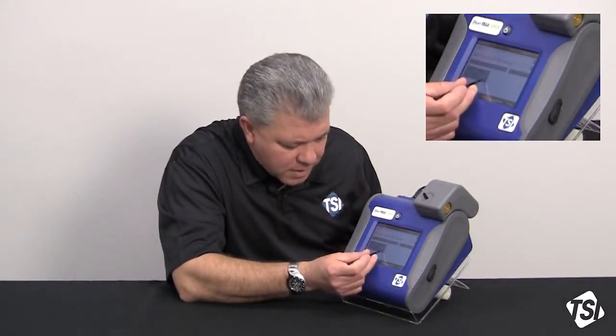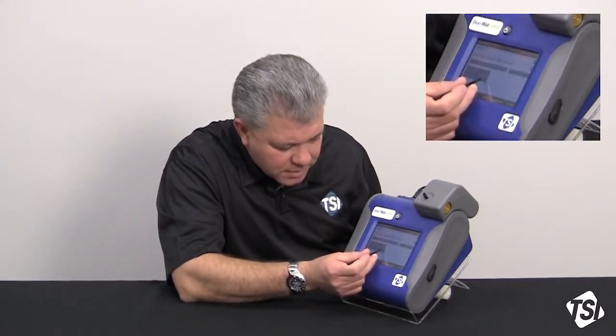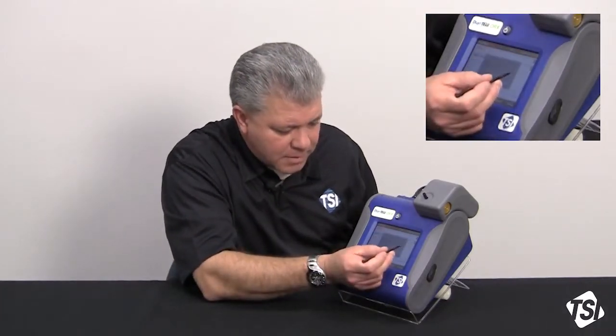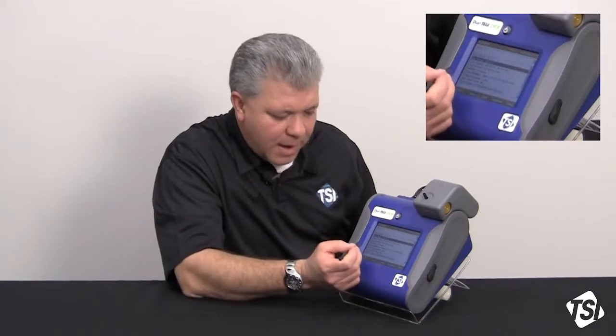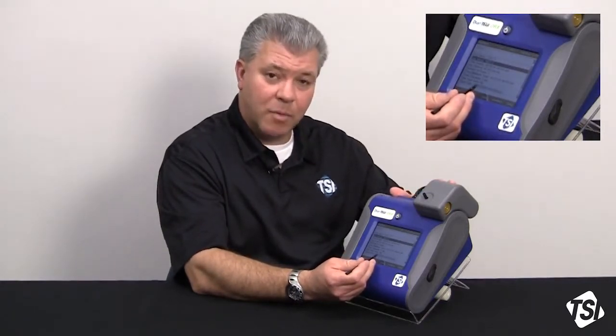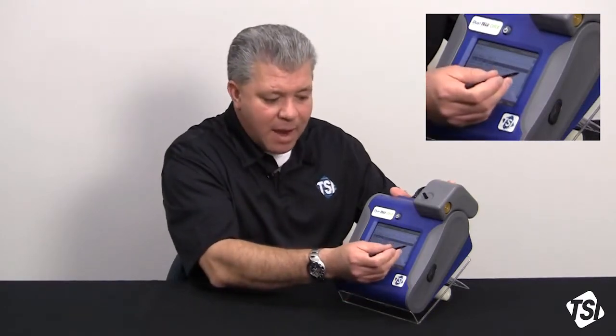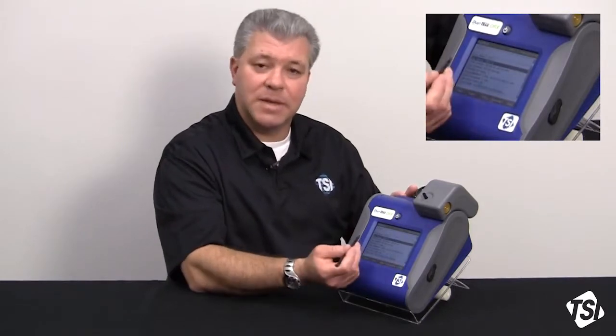So I am going to toggle this down to 6 hours, right like that, and hit set. Now I have turned on the Auto Zero module function. I have set an Auto Zero interval at which the instrument will auto zero itself during sampling. And now I can go back through the rest of the program log mode and set up my test length.